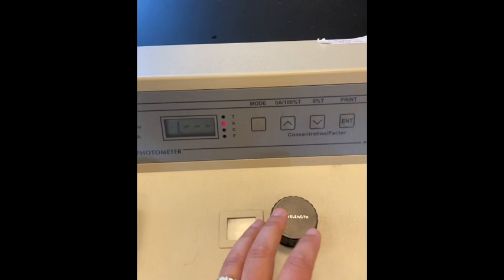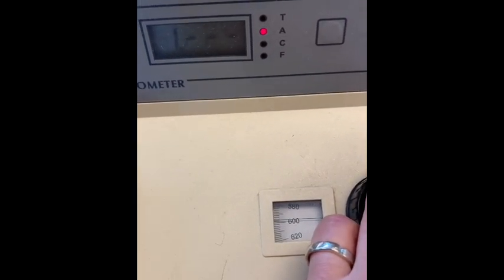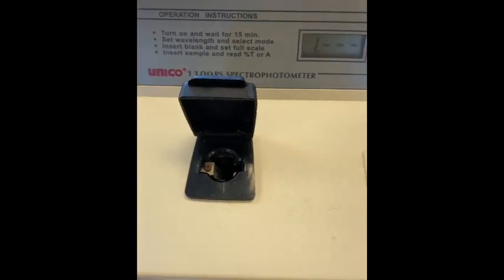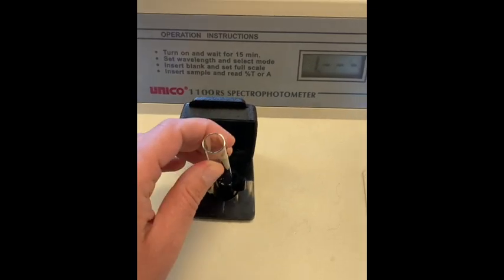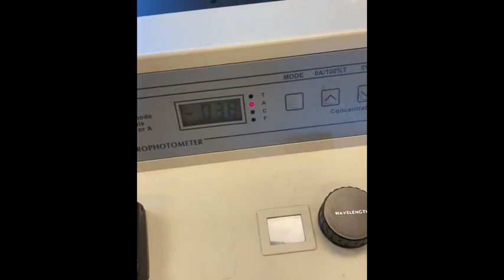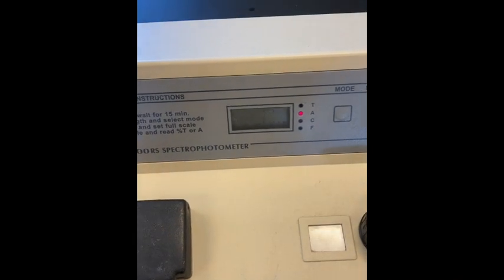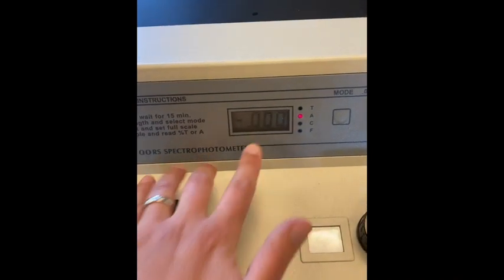The first step is to set the wavelength to 595 nanometers — just a little below 600. Make sure you're in absorbance mode. This is where the sample goes. The first thing you would do is put in your blank, which in this case is our zero concentration. Push it down, close the lid, and press the zero button — 0A, 100% T. This blanks the spec; it basically tells the spectrophotometer to ignore the Bradford reagent. It flashes and then goes to zero.